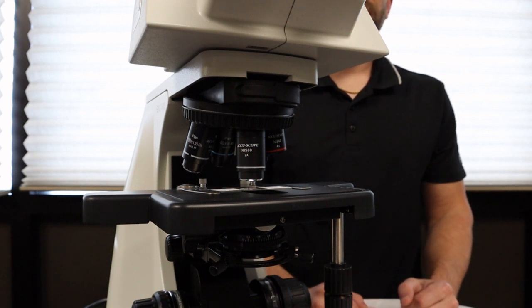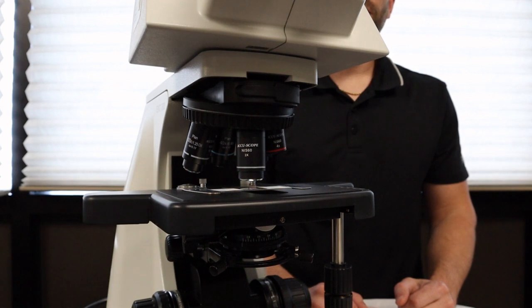When you use a microscope with a 2x objective lens, you need either a flip-in, flip-out condenser or a diffusion slider to fill the whole field of view with light.